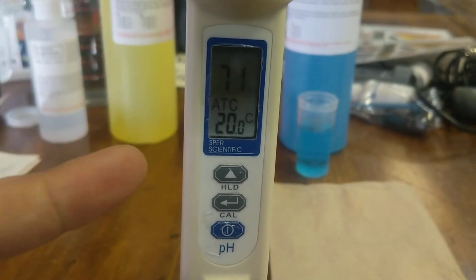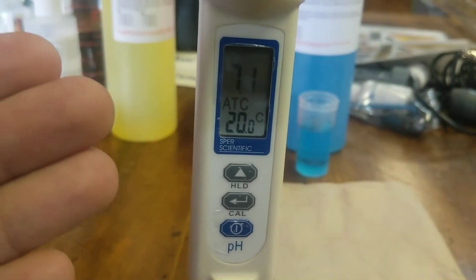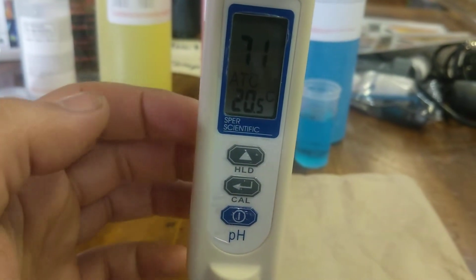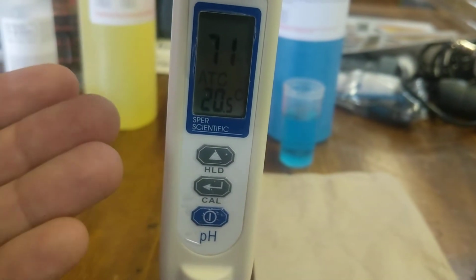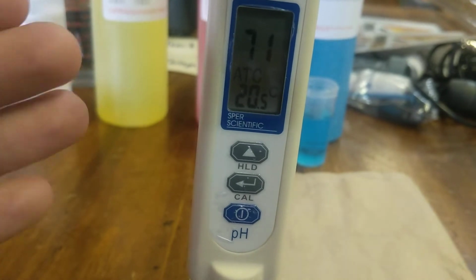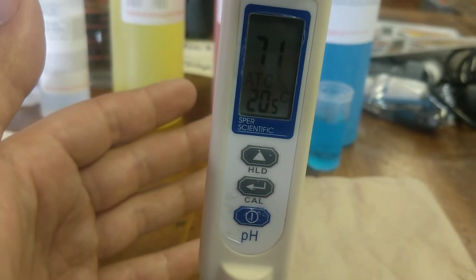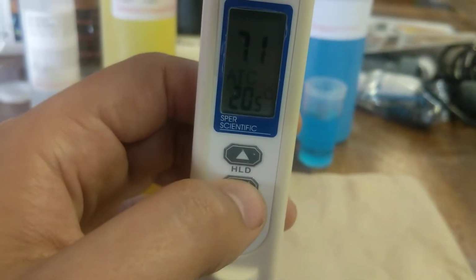This one here in particular was at 7.9, 8.0, very, very out of tune. This is one of the old ones that I have, but you'll notice that it's kept calibration pretty good. Again, you'll want to wait quite a bit of time for it to stabilize. I would say, 5-ish minutes. In this case, I'm not going to do that because it's very close and I've already calibrated it.